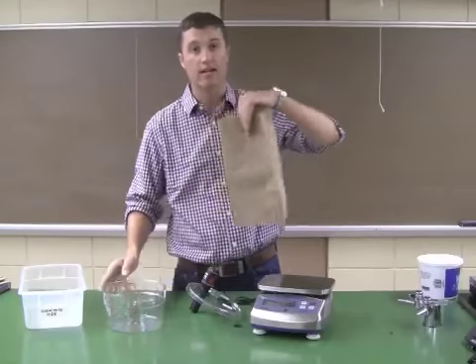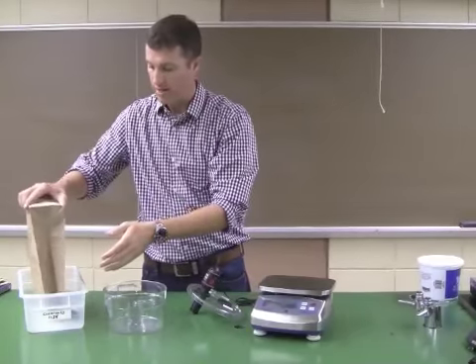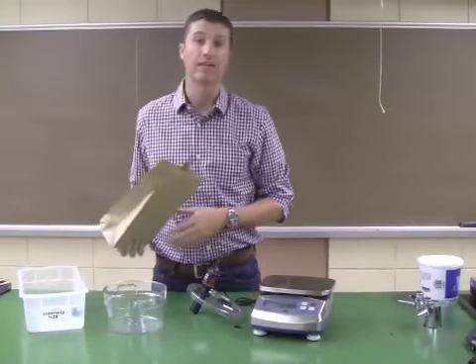Put them back in the sack, carry them back over to their holding container, and put them back in that way.